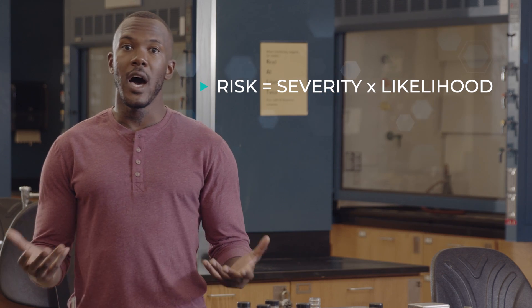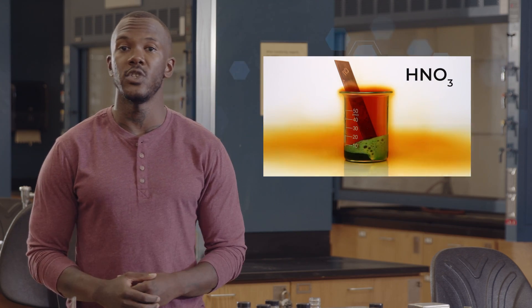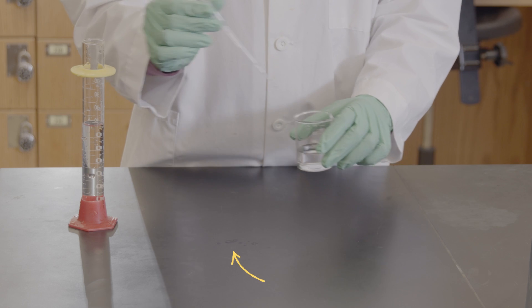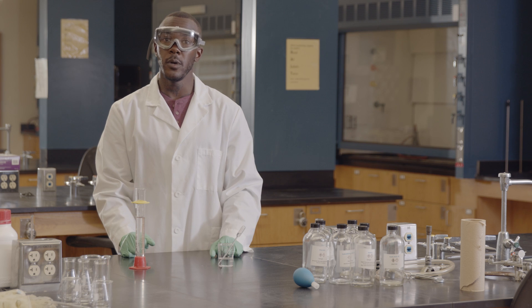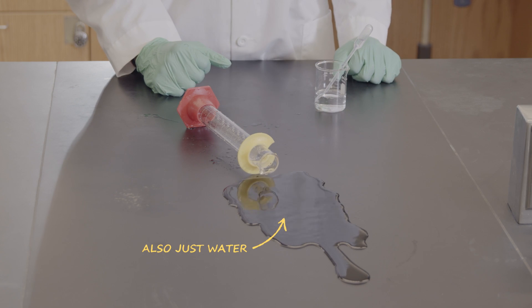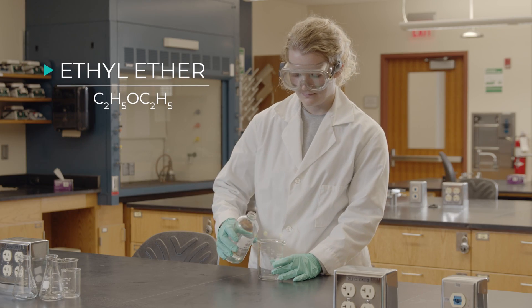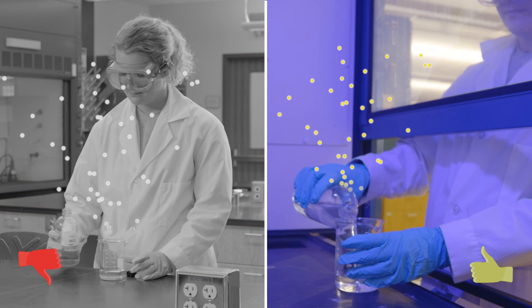For example, a solution with a high concentration of nitric acid is very hazardous since it is both a strong acid and a good oxidizing agent. It's easy to control one drop, and if it got on your skin, it could be easily washed off. On the other hand, if you spill 50 milliliters of the solution on your leg, you get a lot of exposure and it could cause significant damage. You can see that the amount of the acid and the way it's used affects the level of risk. Another example would be the use of a liquid like ethyl ether, where the vapor is unsafe to breathe. Using this in the open part of the lab presents significant risk. Using it in a chemical hood is much safer since the likelihood of inhalation is greatly reduced.